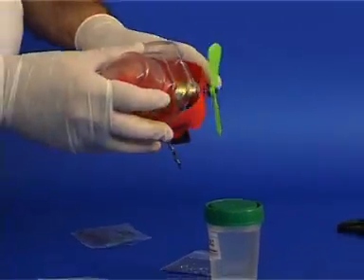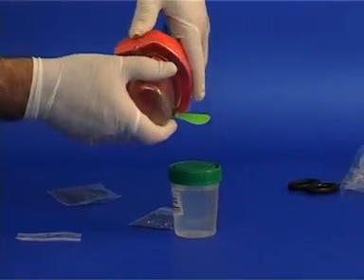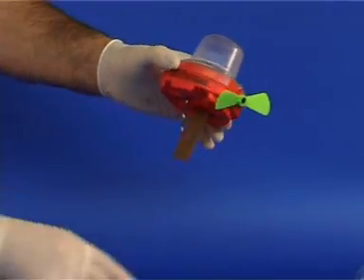Now, replace the transparent cover by first fastening it on the side with a propeller and then pressing the other end. You are now ready to perform the experiment.